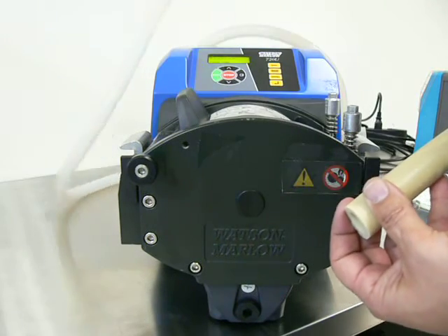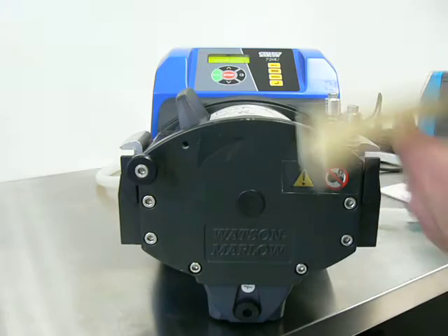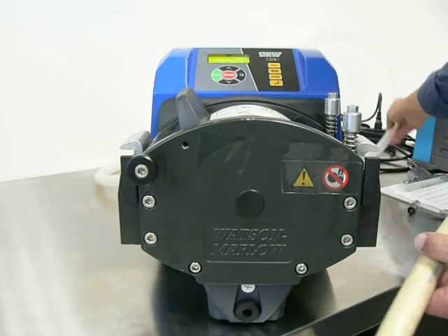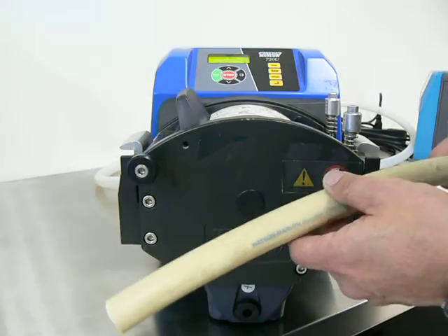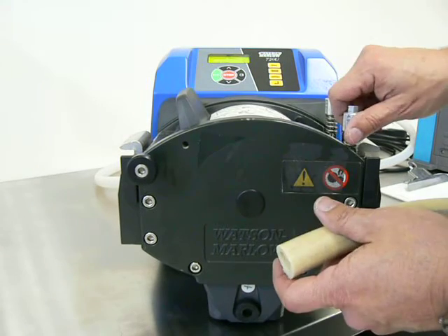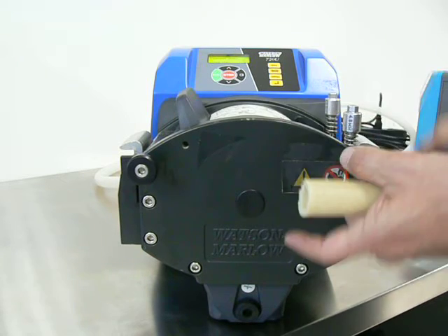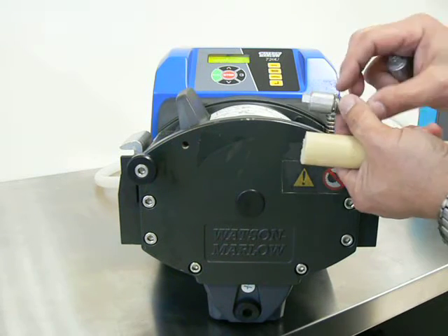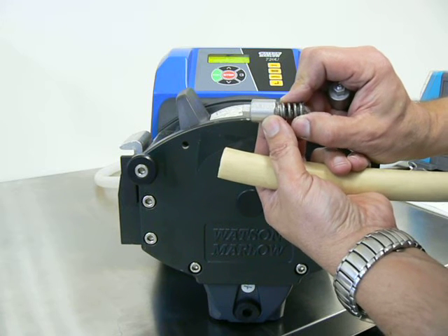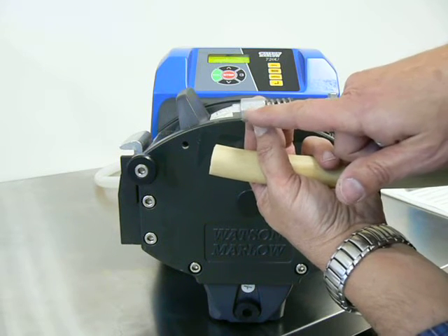Because each pump is designed for a specific wall thickness, and this particular pump is designed for 4.8mm, there are a couple of things to watch out for when choosing and loading tubing. One of the ways you can tell what wall thickness the pump is designed for is on these adjustment knobs — and if you can't see it in the video, I'll put a still photo in — they're labeled 4.8mm.